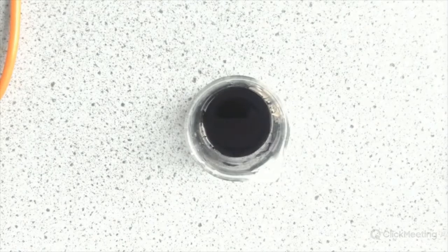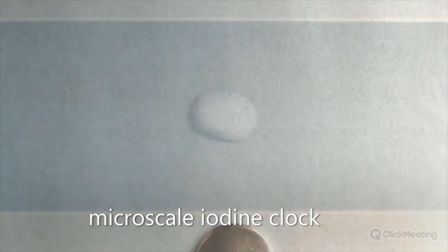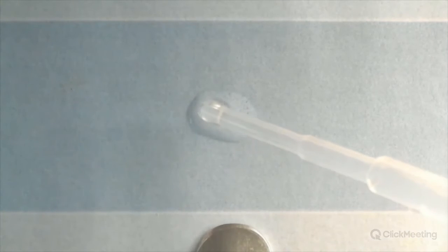Now, this is one good thing about microscale chemistry. You can take large-scale demos and shrink them into small drops, and with the visualizer, almost get the same effect. So this is a microscale iodine clock. So I'm adding some potassium iodate to some sodium metabisulfite and starch.